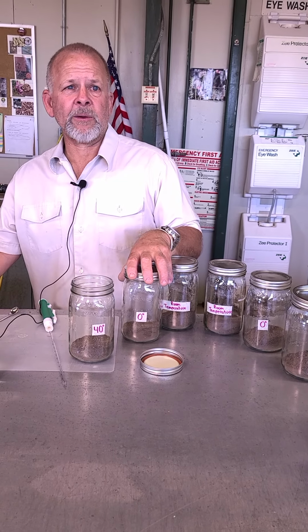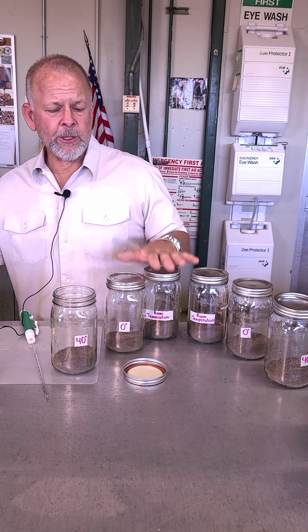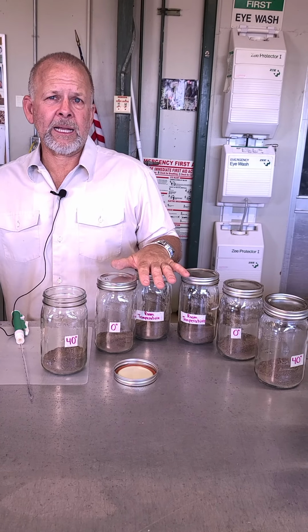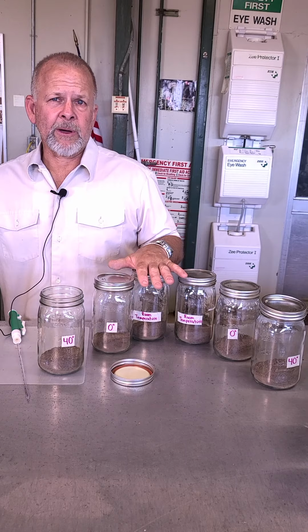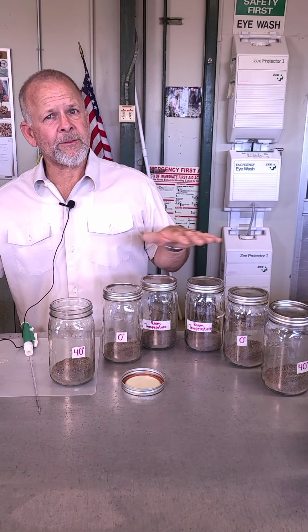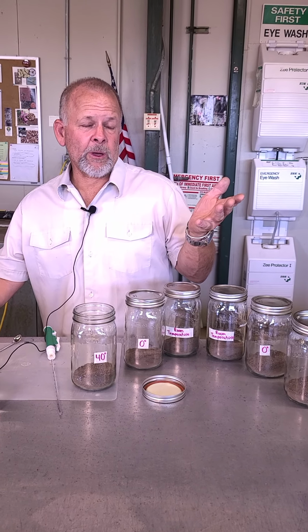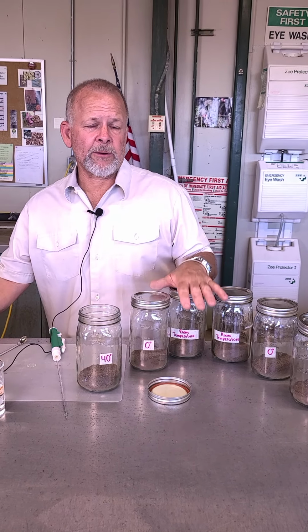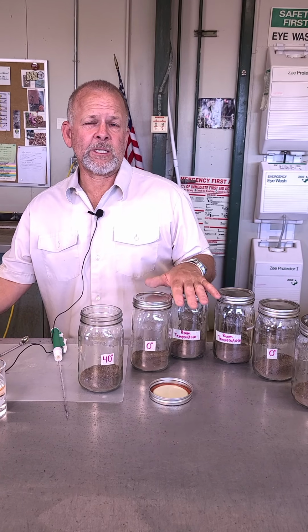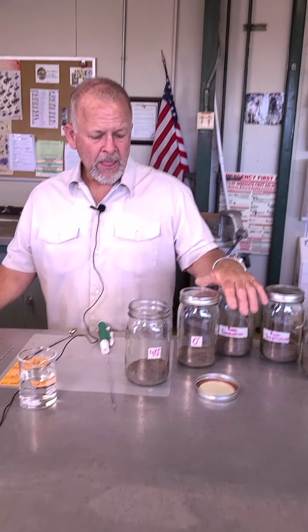The 0 degrees, we'll actually put that in the refrigerator. And the 40 degrees, we've got an oven over here that, if we can get it calibrated just right, will sit right about 104, 105 degrees. But we'll measure that anyway. So we'll have a wide variety of different temperatures to compare. There'll be 3 temperatures, but it'll cover quite a range, from freezing to 104, 105 degrees Fahrenheit.